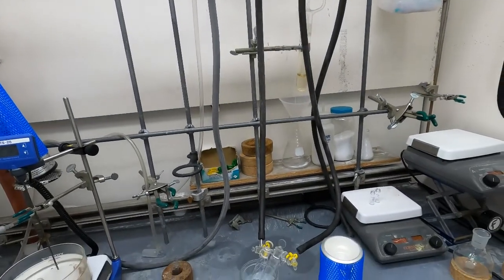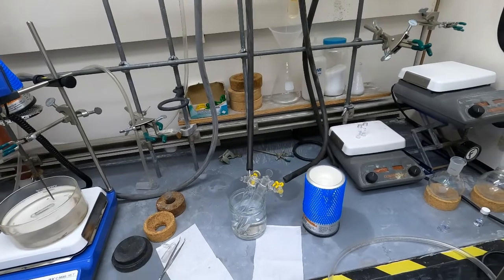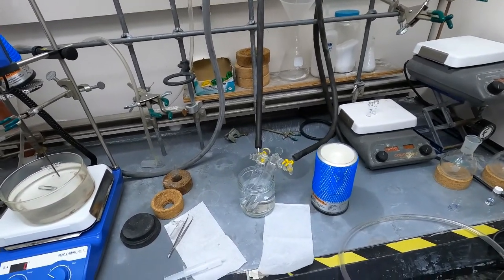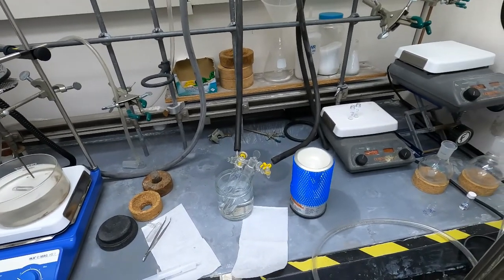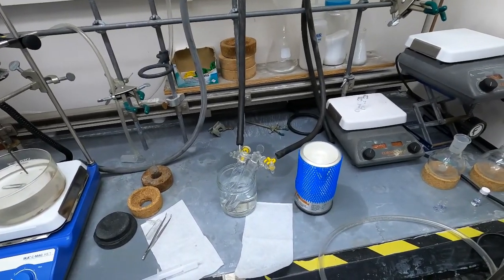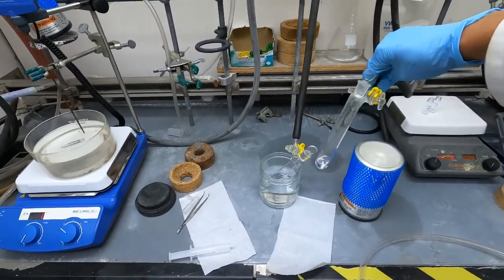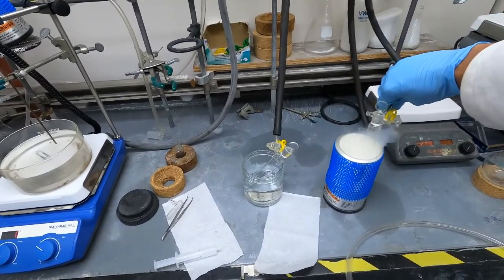Just our vacuum tubing is under vacuum but the Schlenk tube is not. We're going to start the freeze pump thaw. By the name you can probably tell that the first thing we're going to do is freeze the contents of the Schlenk tubes.